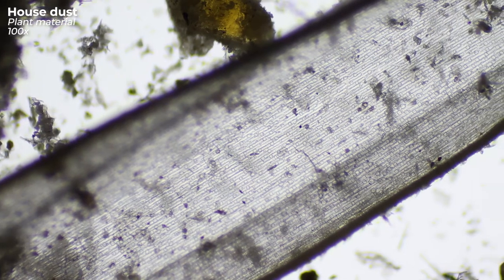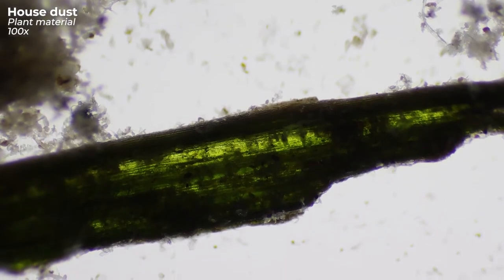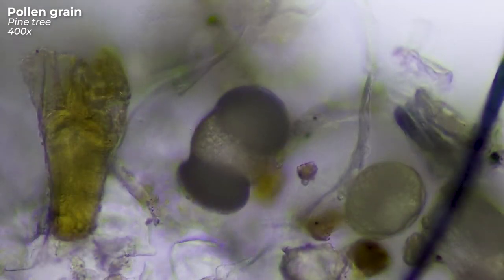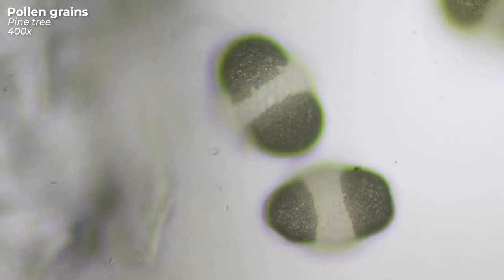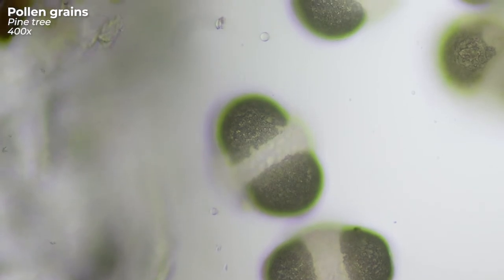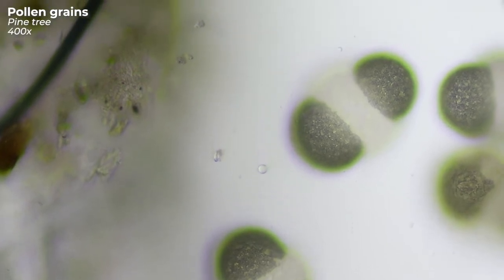This is some piece of plant material, and this one too. This also belongs to a plant — or more precisely, it belongs to a tree. It is a pollen grain from a pine tree, and in my house dust I can find quite a few of them since pine trees are right outside my door. They get into my apartment through an open window, especially when it's windy outside.